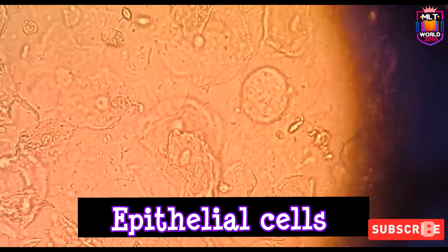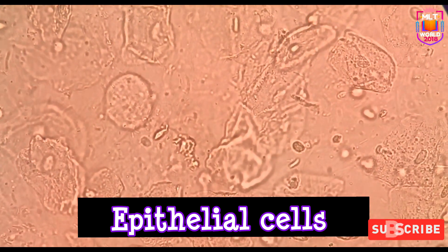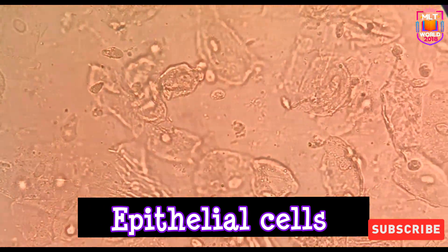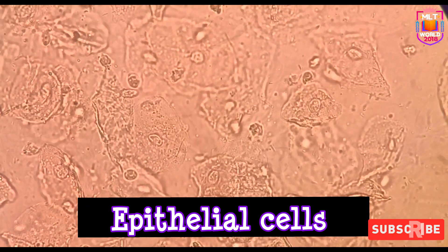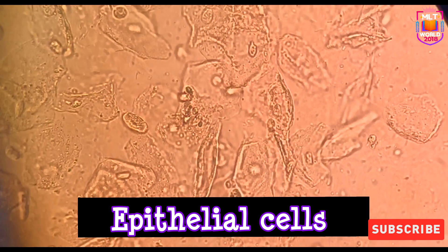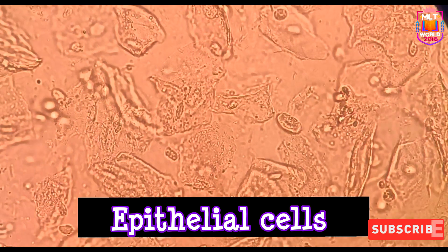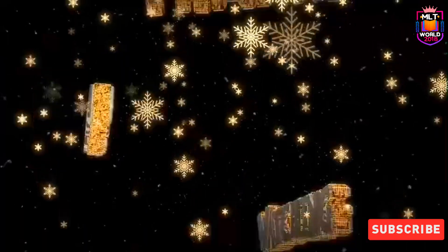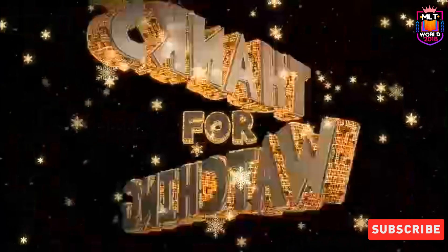If you see one big round cell with a center nucleus, that will be an epithelial cell. Now you see in this smear it is full of epithelial cells. In each epithelial cell there is a nucleus in the center, the shape is totally different, and they are bigger than pus cells and red cells. As I mentioned, mostly you will find squamous epithelial cells in urine microscopy.